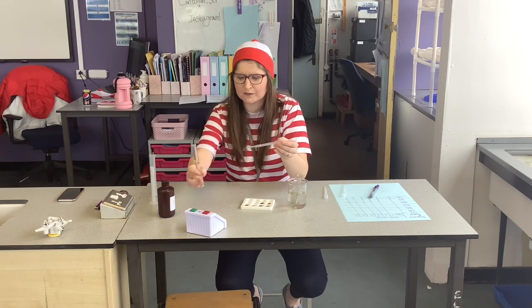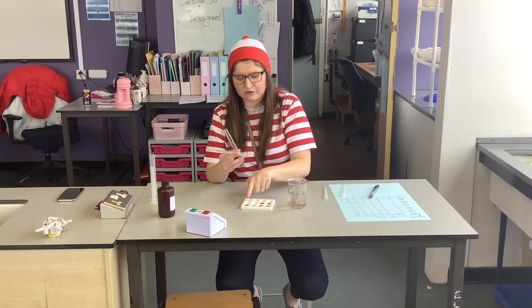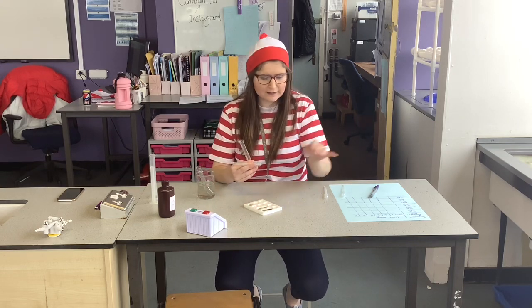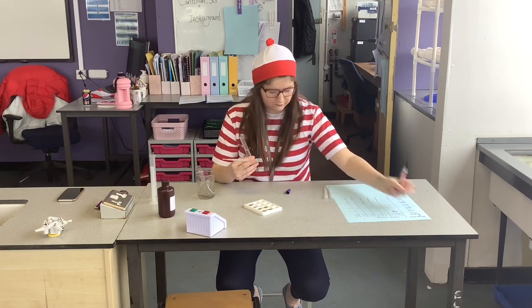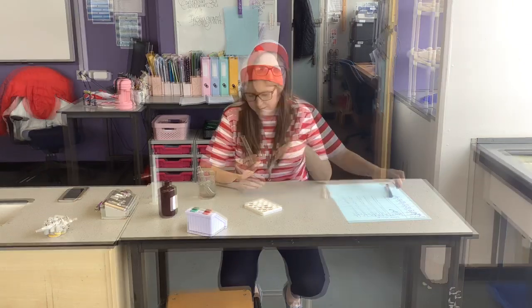Then I have to start the stopwatch, and every minute for the next 5 minutes I'm going to add drops into each of my iodine. Then I'm going to record my colour change. So immediately after, my iodine turned blue black. And if you know what the colour change on the food test tells us, it means there is still starch present. The starch hasn't been broken down.